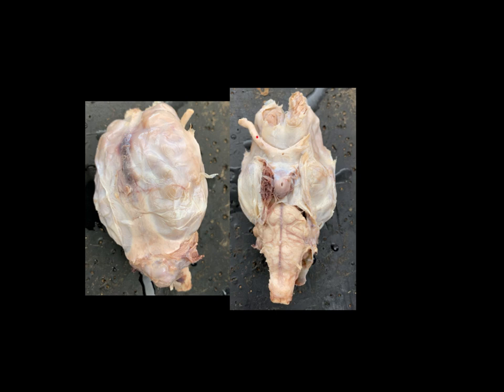We can also see on this side, and part of one on this side — it would extend but it's been cut — these are the optic nerves. These are the nerves that run to the eyeballs and convey sensory information from the eyes to the brain. Now it might be a little tough to tell here, but these actually cross over. And this point where they cross is called the optic chiasma. Chiasm means an X or a cross, so the point where the two optic nerves cross is the optic chiasma.